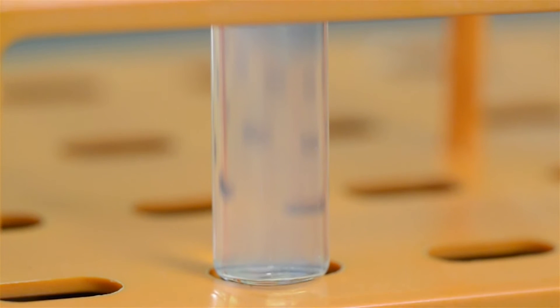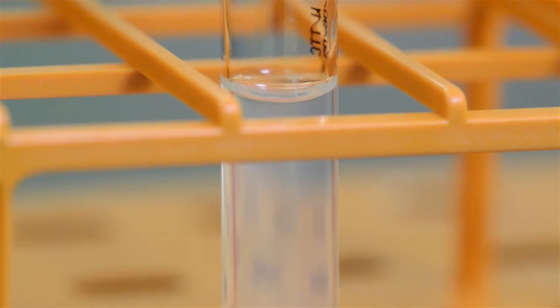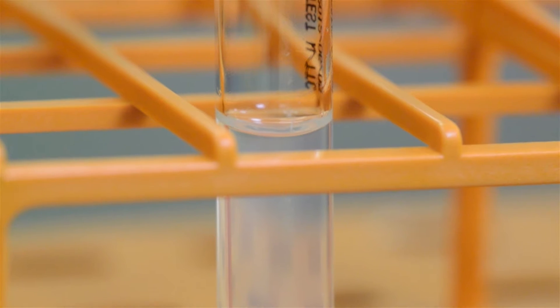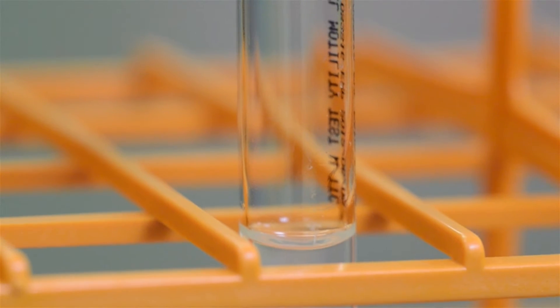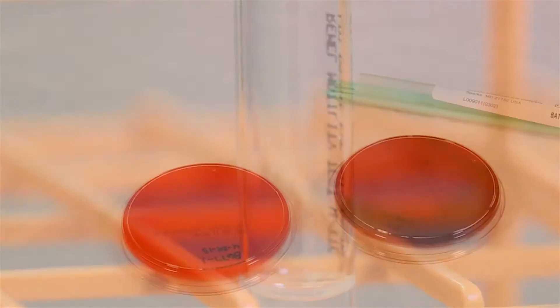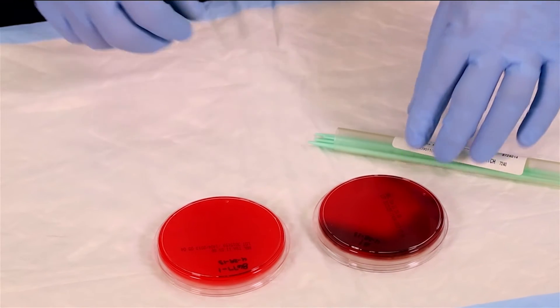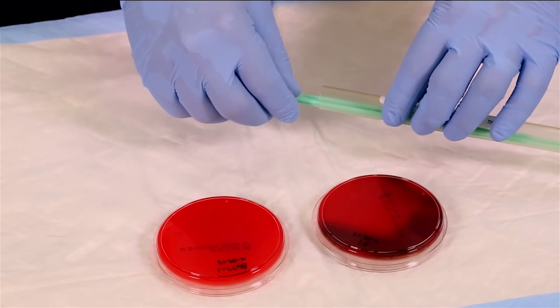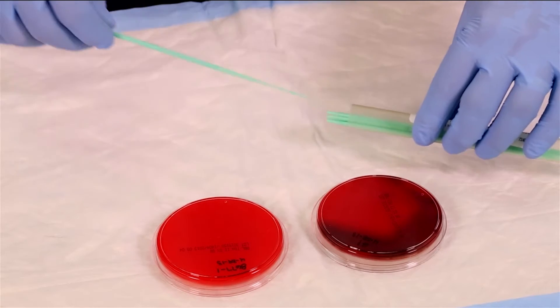Motility media with TTC — triphenyl tetrazolium chloride — is a colorless salt that turns red when it becomes reduced as a result of bacterial metabolism. For our samples, we have two agar plates containing two isolated colony types that are 18 to 24 hours old.